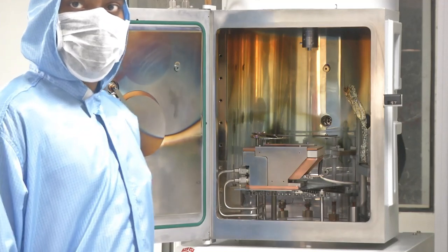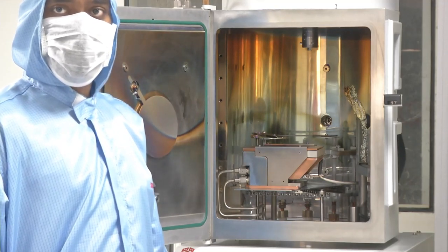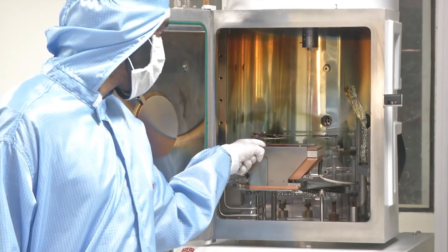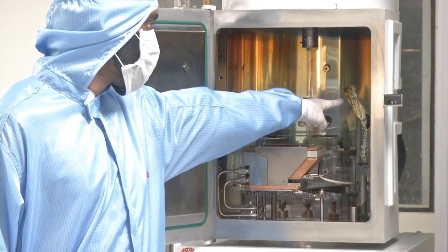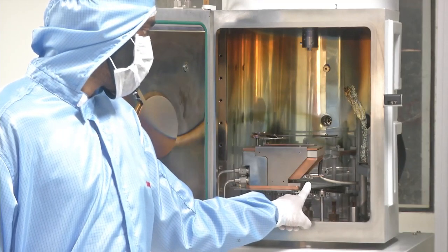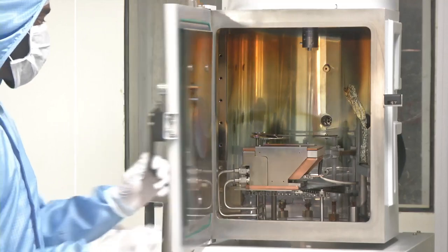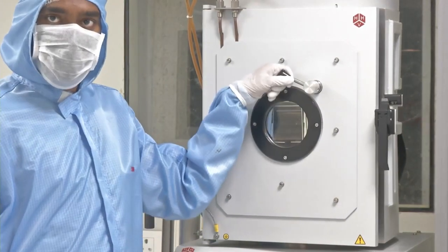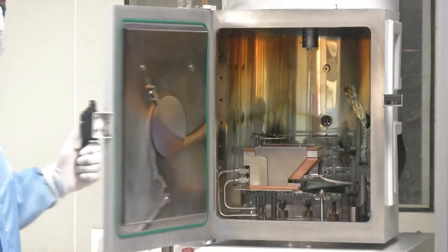The main constituents of an electron beam evaporator vacuum chamber are: crucible, crystal oscillator, filament, and window for observation. Let us now look at these components in detail one by one.